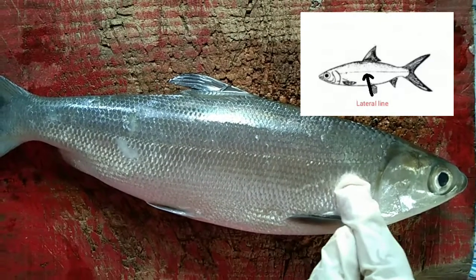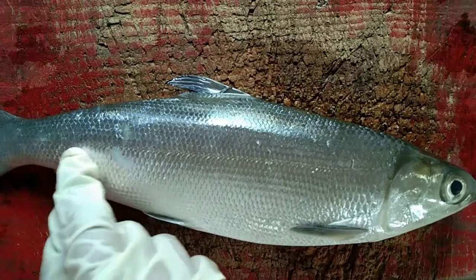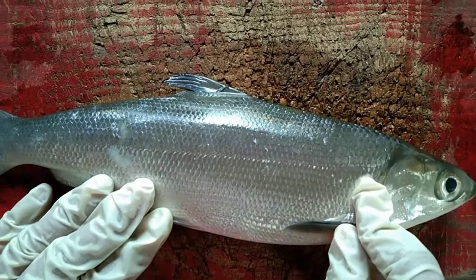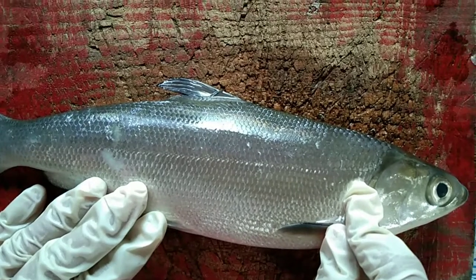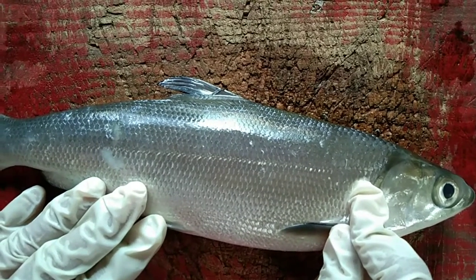This is the lateral line of the fish. It serves as a sensory organ and it senses water currents, pressure, and movement in the water.